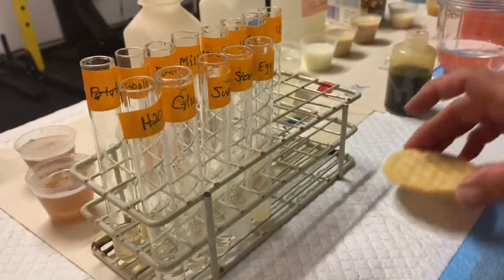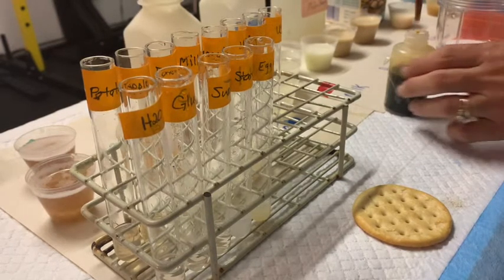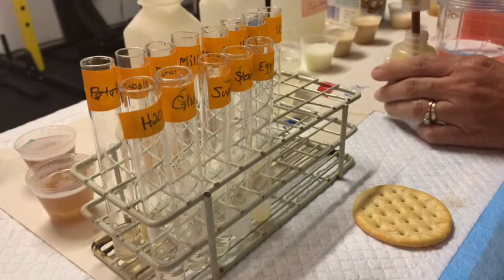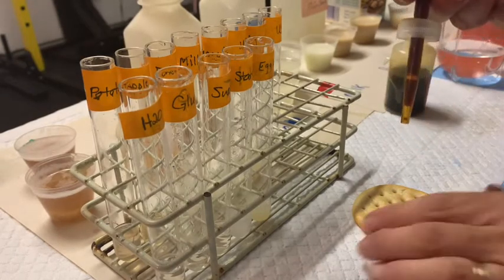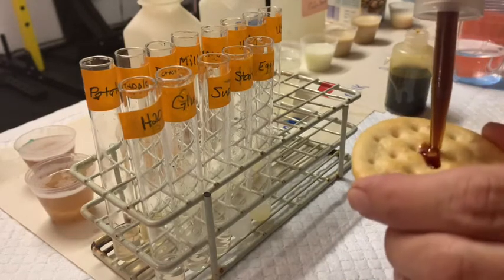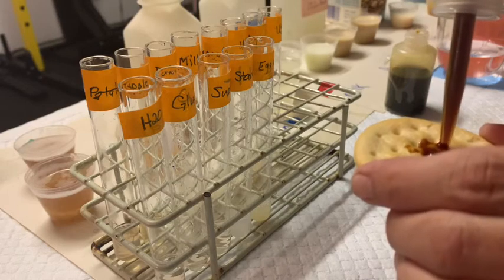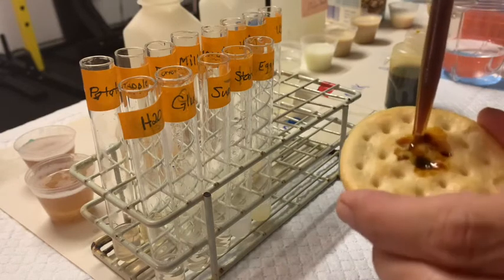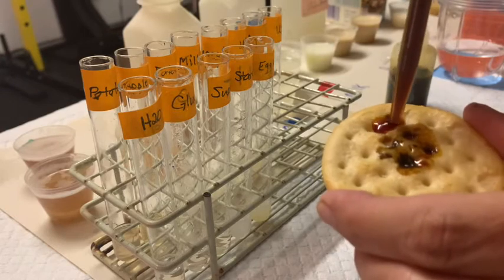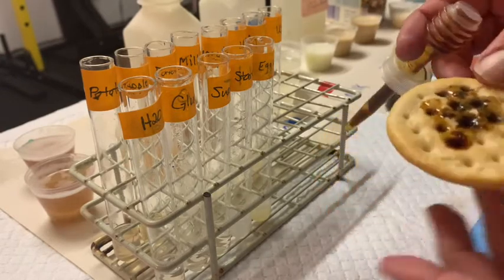You're probably wondering why I have a cracker here. I'm just going to show you what I'm talking about. I'm going to take a little bit of this potassium iodide using the dropper of the bottle, and I'm going to drop it onto this cracker. Hopefully you'll be able to see that as it starts to hit the starch it's going to turn black. It's going to take a couple seconds — but can you see how it's going black?